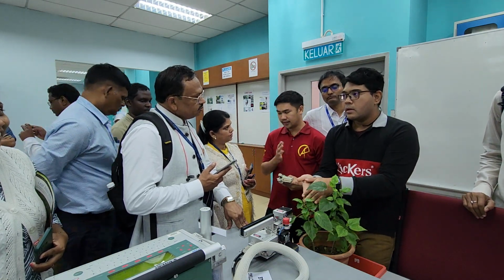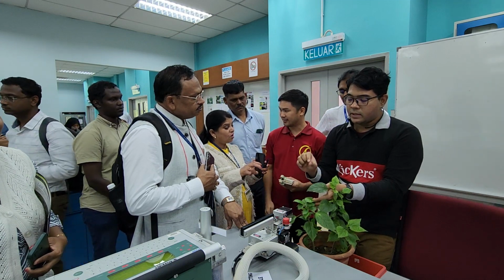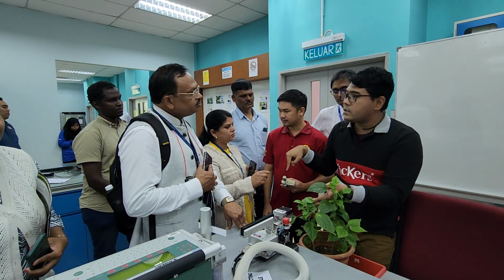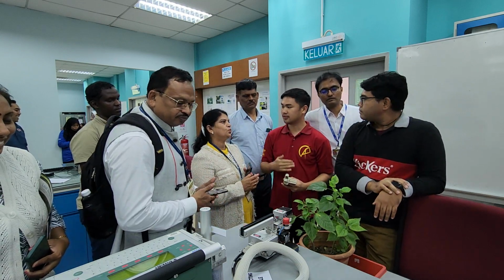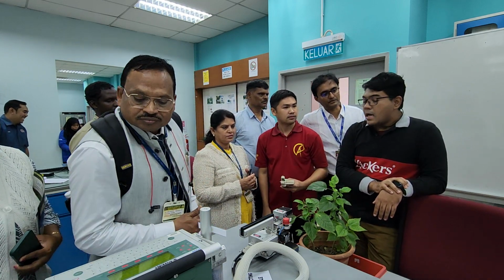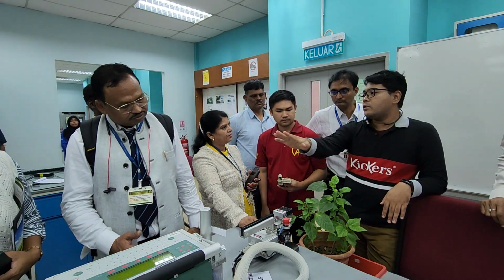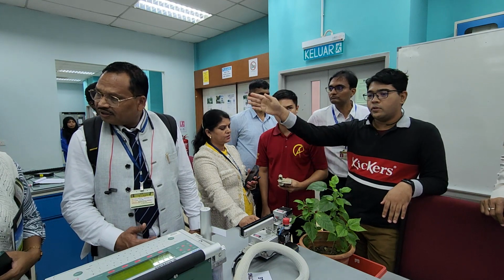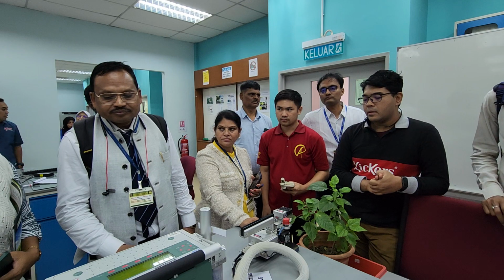Use tissue, because if water is present, it will cause refraction of the laser being shot at the surface. Keep it dry. Dust or wet moisture should not be there. Moisture shouldn't be present on the leaf, regardless of the equipment that you're using, photosynthesis equipment or leaf spectrometer.